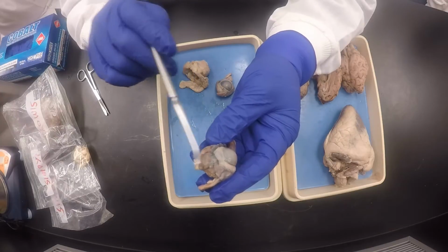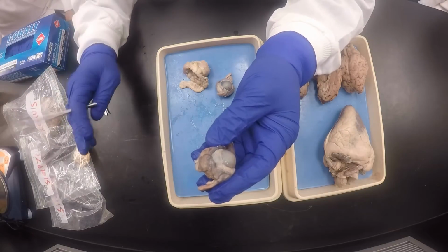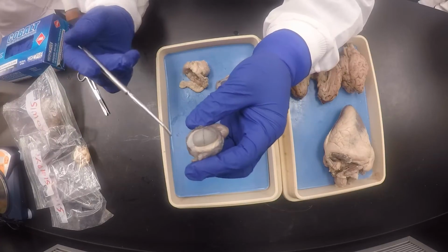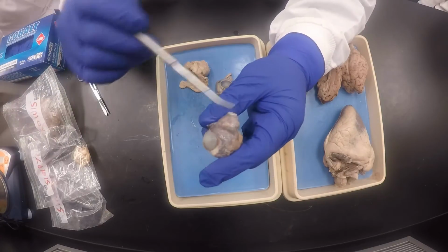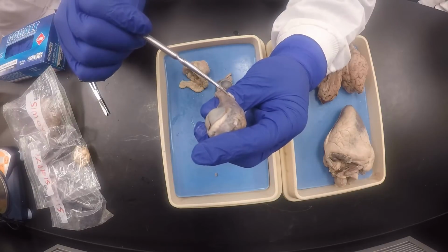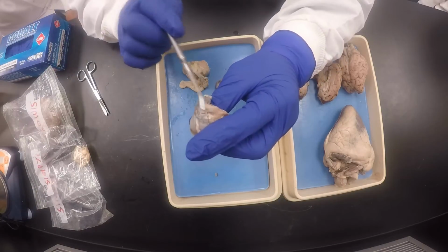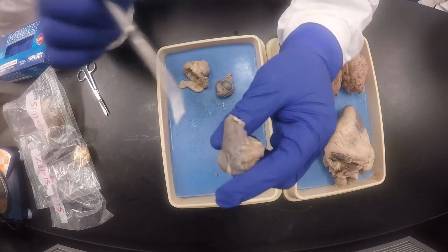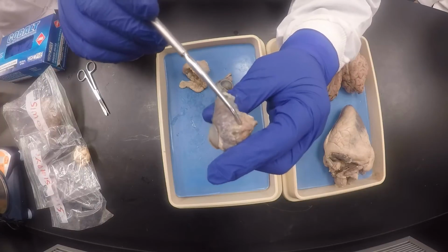So what are you looking for? You're looking for two muscles: one that's going at an angle and one that's going straight out. So I have to look at the other side. And then what do I see on that side? Yes. I see this one that's falling down, and then I see this one that's going straight out. So therefore, the one that's going straight out, that says that this is the lateral rectus.